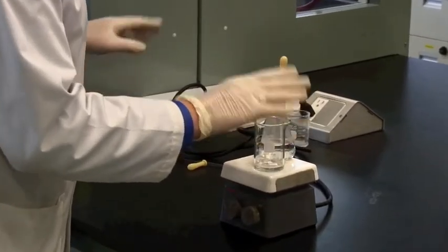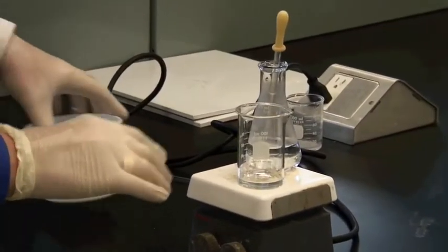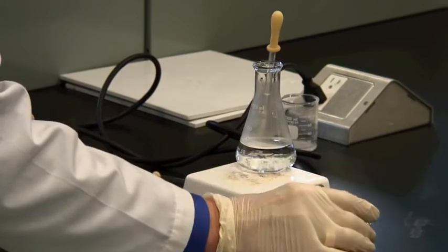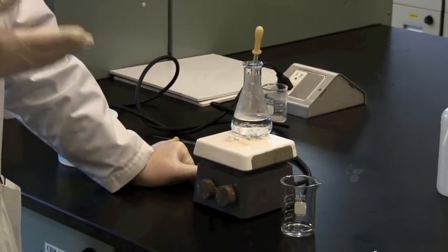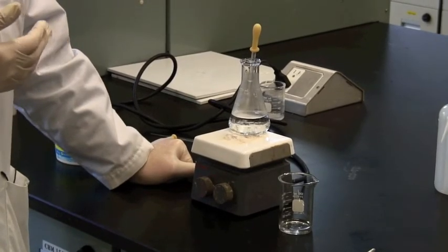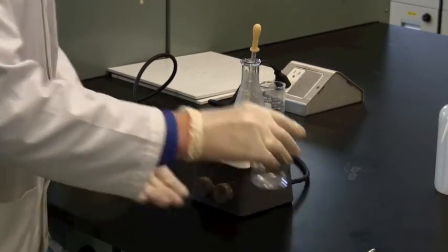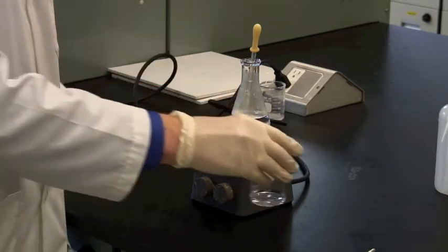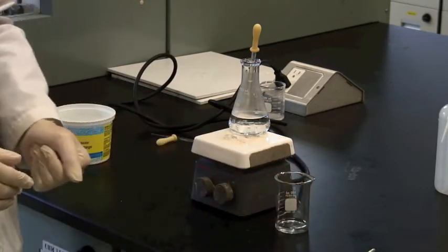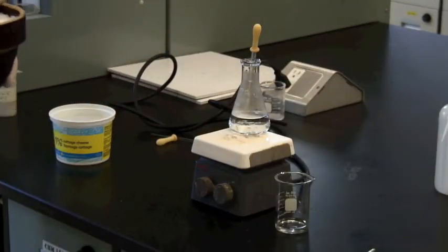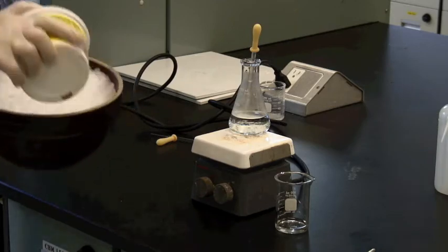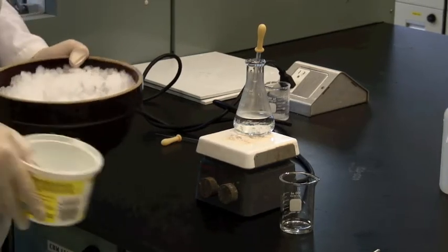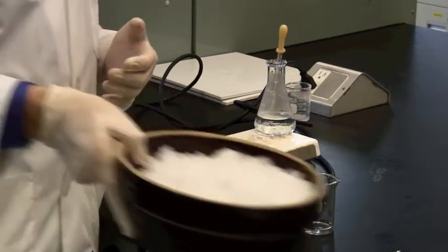And once you have got this in boiling situation, you take it off the heat and put it aside to cool, and you leave it on the bench cooling until it's room temperature. When you can put your hand underneath it, and it doesn't feel too hot, then you're ready to chill. We do have ice, which appears in the lab in bowls like this, actually over on the side benches.